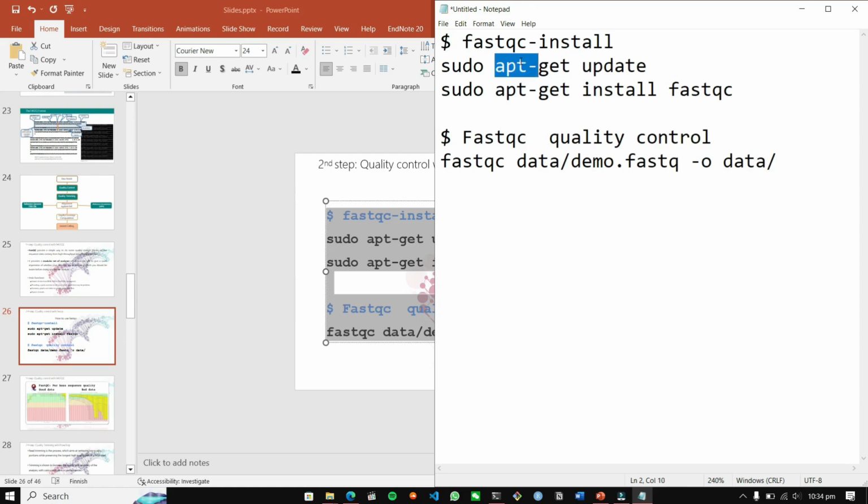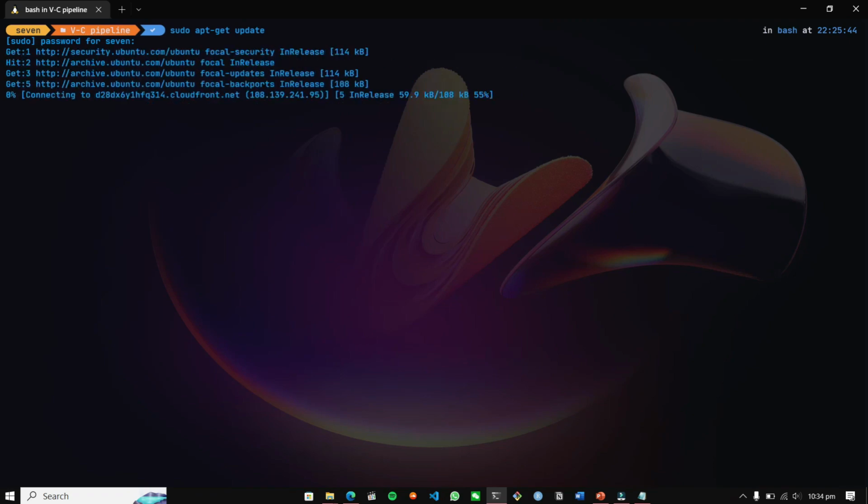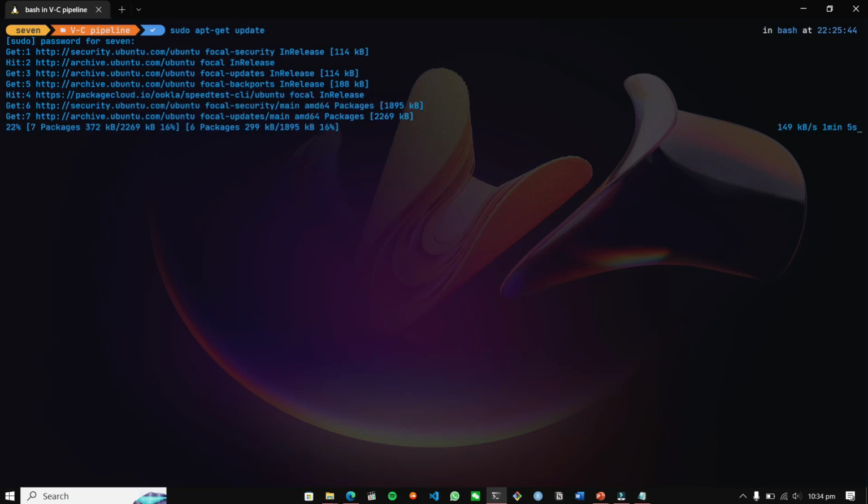We are going to copy these commands and paste them in our notepad. Then we have to update the system. So let's just update our system and see if there are any updates available. I'm going to type my password and then see. Yes, there are updates available for my system. It's checking if 6 packages have updates, 7 packages have updates.